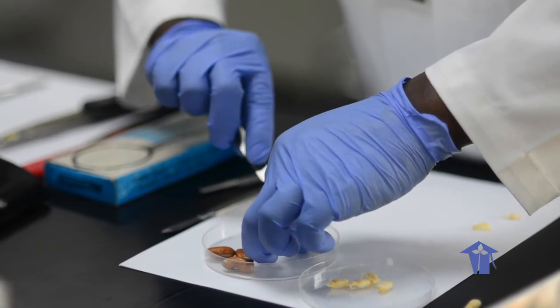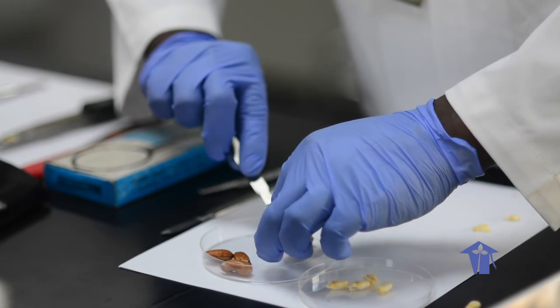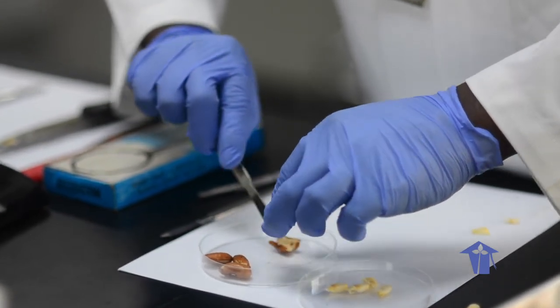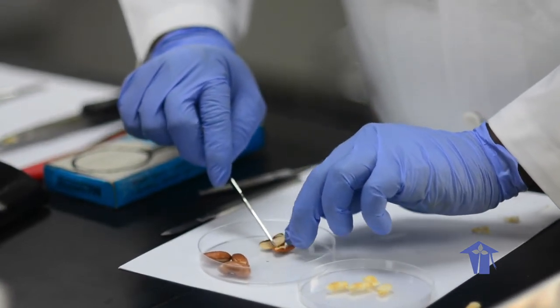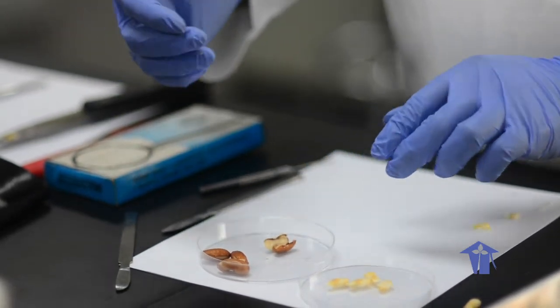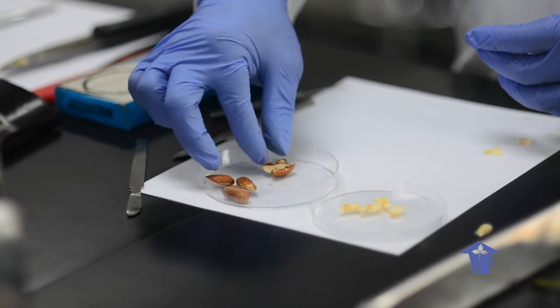lab, whether it's corn, or for those of you later on, you may be dissecting animals. Again, you want a sharp blade and a controlled cut. And the other thing that could change with a dissection lab is, say for example, if you have harder tissue, then you'd need a larger blade. Which is why butchers have various knives for the various things they want to cut.